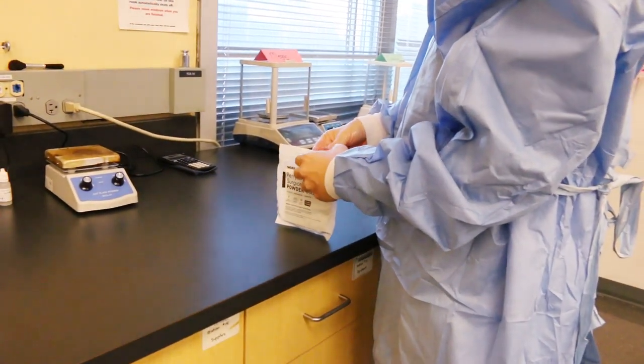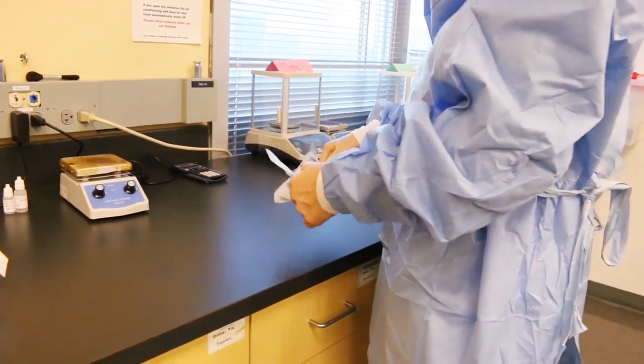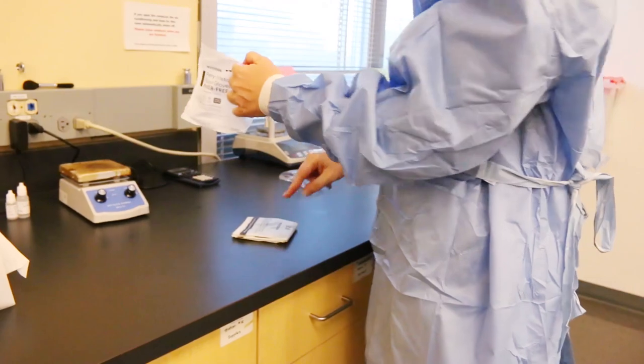Step 25 is to open your sterile glove package and place it on a clean surface.